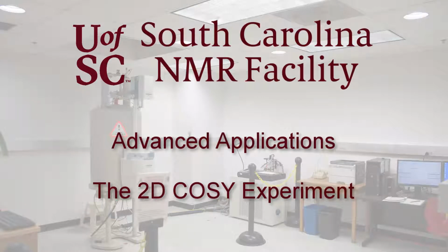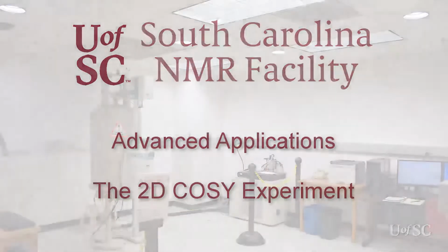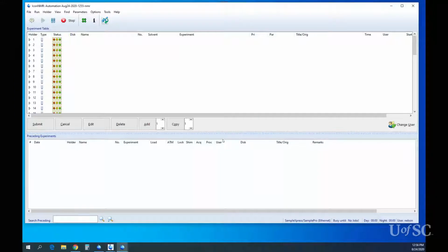In this video we will show how to run a two-dimensional proton COSY experiment in IconNMR. We will also show a couple of issues with the automated processing of the data and how to fix them. Finally, we will give the basic interpretation of the results and how to use them to help assign the NMR spectrum. To run a COSY experiment, first log into IconNMR as you would normally do.